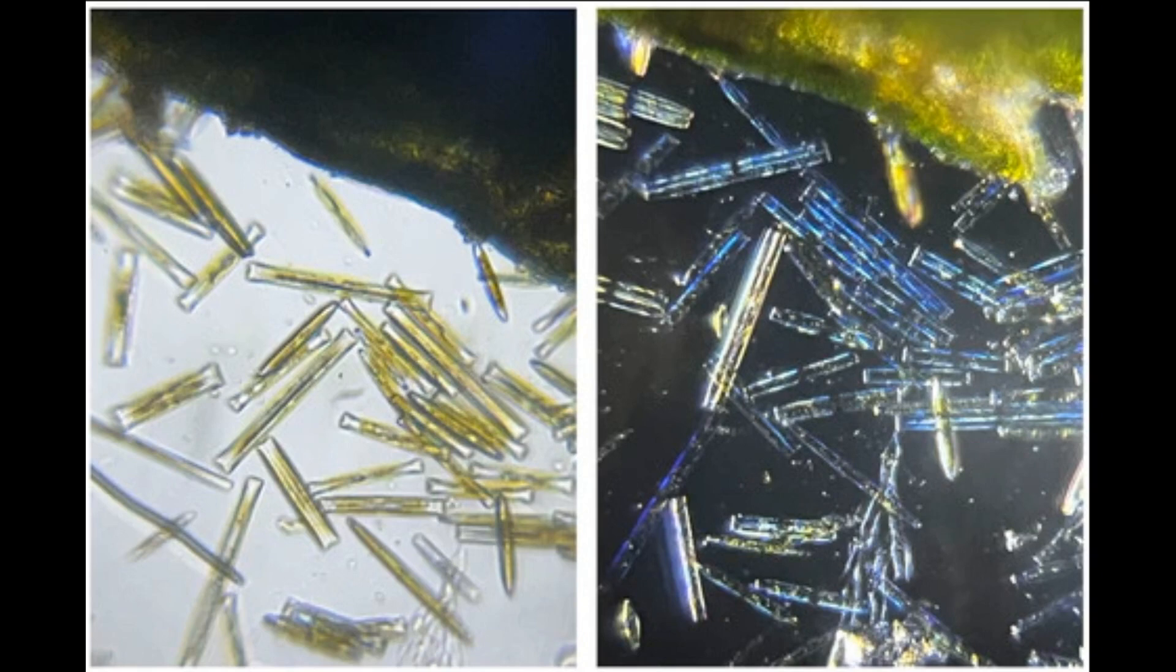Some specimens are easier to observe and more striking to view when the light reaches them indirectly. Because the light is coming from an angle rather than below, the background becomes dark, which contrasts sharply with the illuminated sample. To achieve this effect, shift the LED light on your Foldscope to the side. The background will turn dark and the sample will appear to glow as the diatoms below.